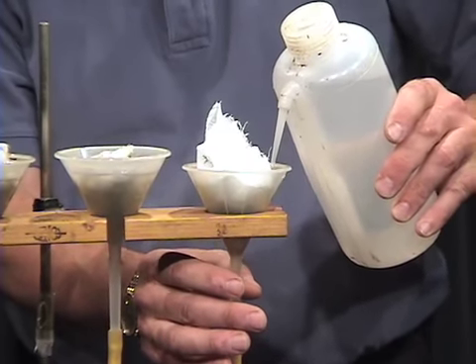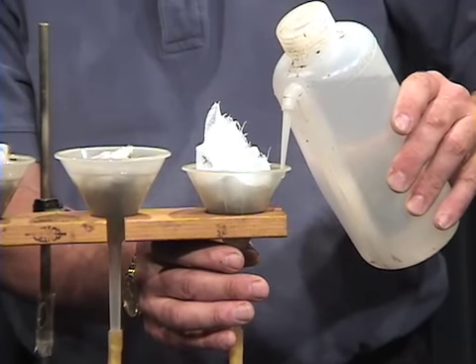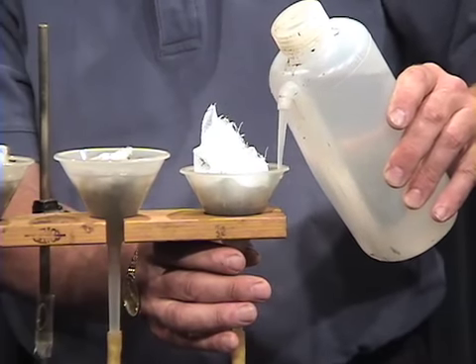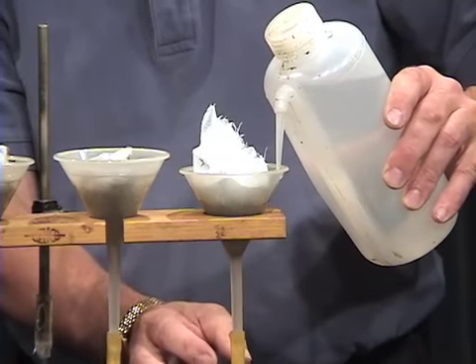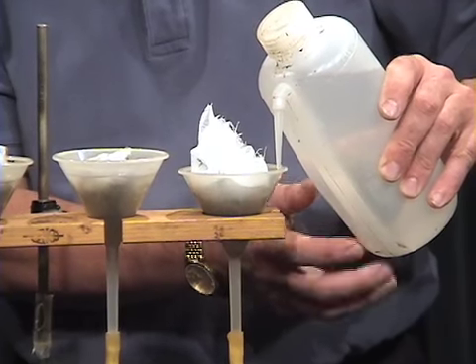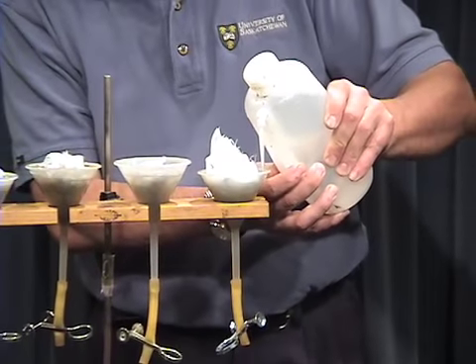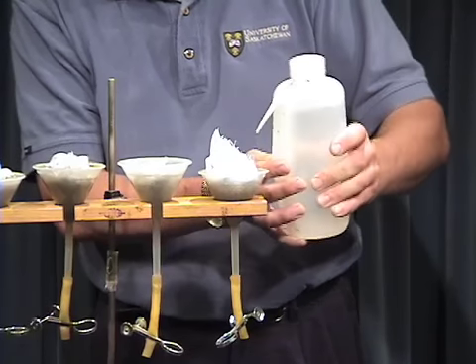So what I want to do is, in essence, I'm going to submerge all of the soil in water. The reason I use the cheesecloth is to try and avoid too much of the soil material from settling in the bottom of the funnel, because that's where I want ultimately to find the soil microorganisms. So I'll fill this right up like this. There, that's good enough for now.